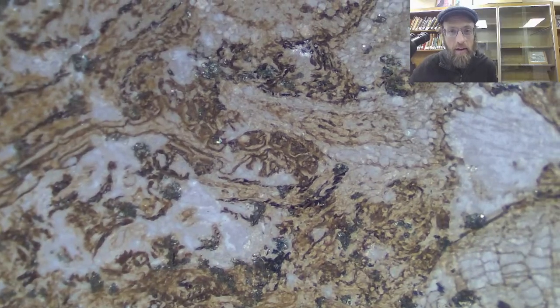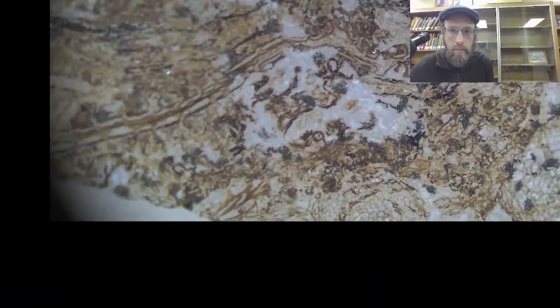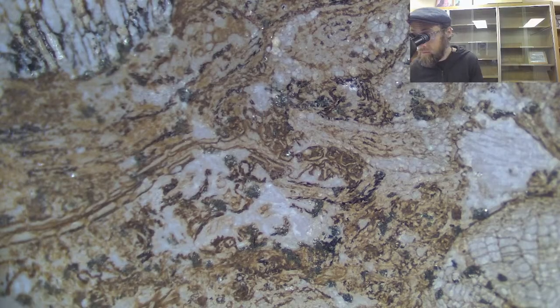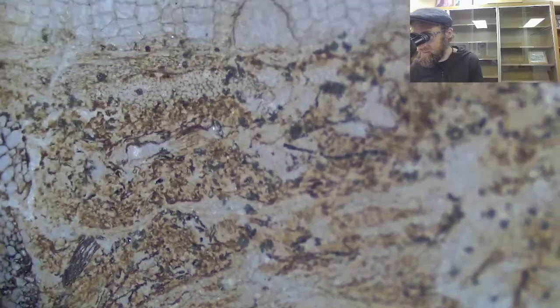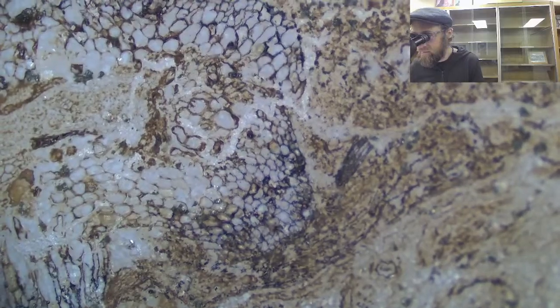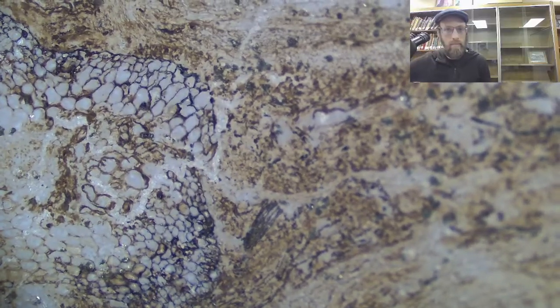So this is a bit cone-like. That's sort of interesting.